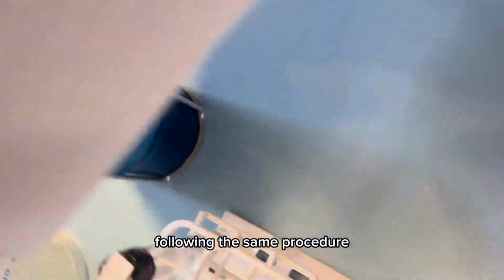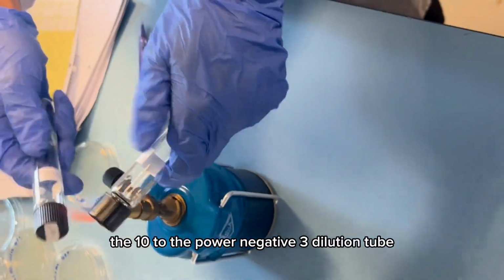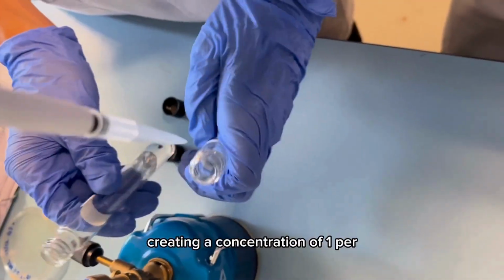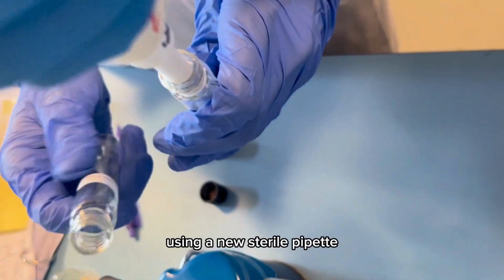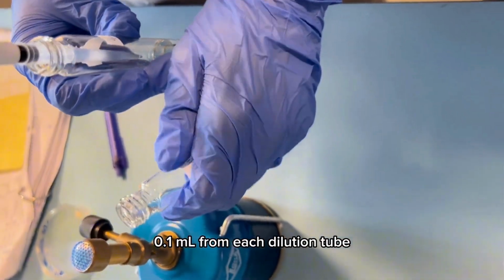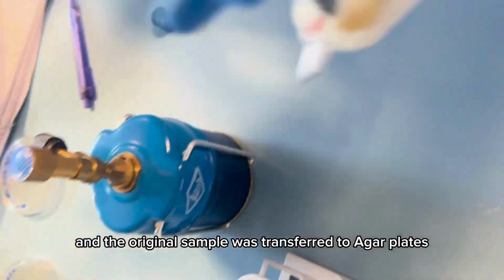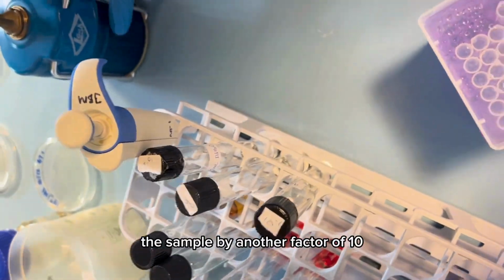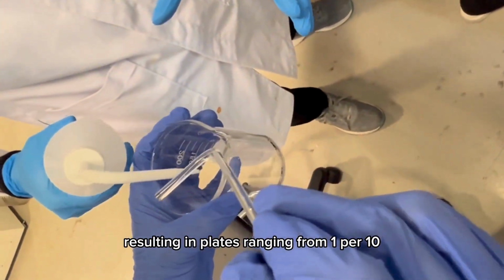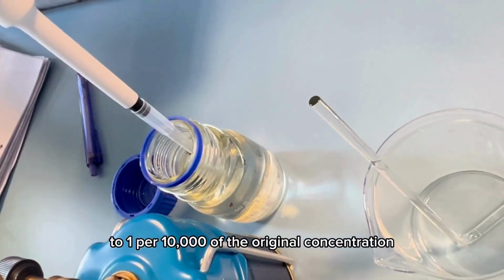Following the same procedure, 1 ml from the 10 to the power negative 2 dilution was transferred to the 10 to the power negative 3 dilution tube, creating a concentration of 1 per 1000 of the original sample. Using a new sterile pipette, 0.1 ml from each dilution tube and the original sample was transferred to agar plates. This step effectively dilutes the sample by another factor of 10, resulting in plates ranging from 1 per 10 to 1 per 10,000 of the original concentration.